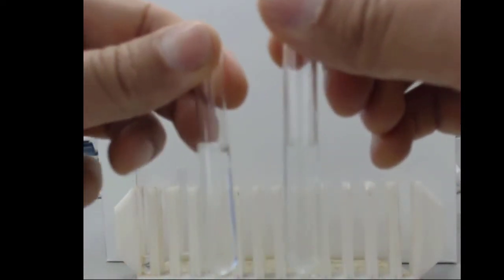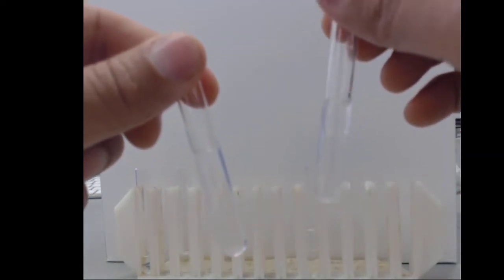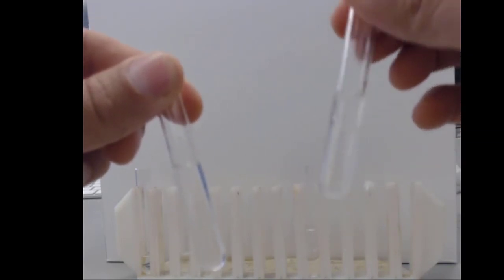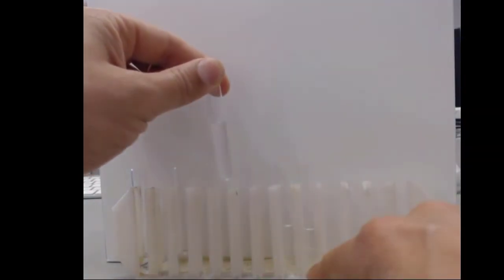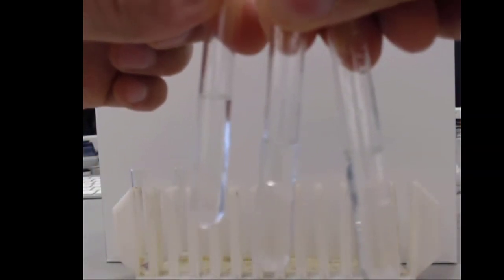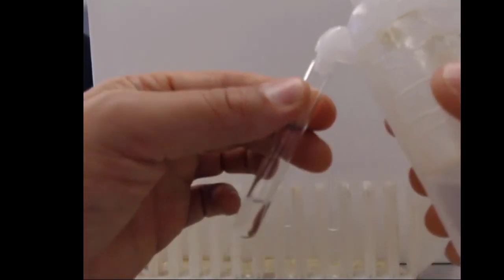And the reason we see that difference between propanol and butanol is because propanol has a shorter carbon chain than butanol. Propanol's the 3-carbon chain, butanol's the 4-carbon chain. So if you put these in order of chain length, the two things with the longer carbon chain split their layers up still, and the thing with the shorter carbon chain ends up with no layer. We can kind of deduce what's going to happen with ethanol and methanol at this point, right? If propanol mixed with the shorter carbon chain, ethanol with only 2 carbons should mix as well.